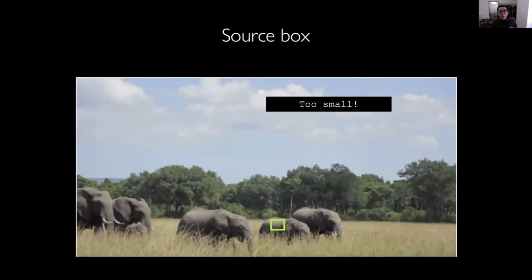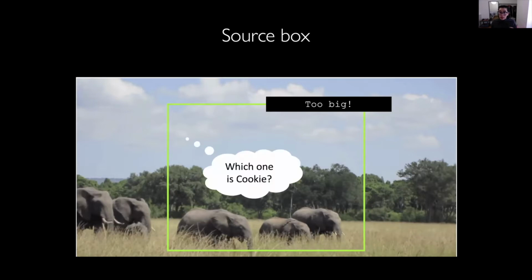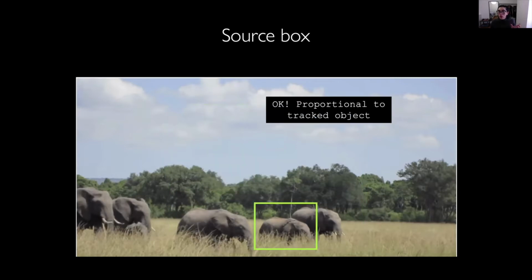If it's too small, the software might be confused, as there are many regions of the frame that have the same characteristics. So for example, here on other elephants or even in the cloud. If it's too big, on the other hand, the software might be just as confused because it will not know which one is our object of interest, so which one is Cookie. So a good rule of thumb is to start with a source box that is proportional to the size of the object we want to track.